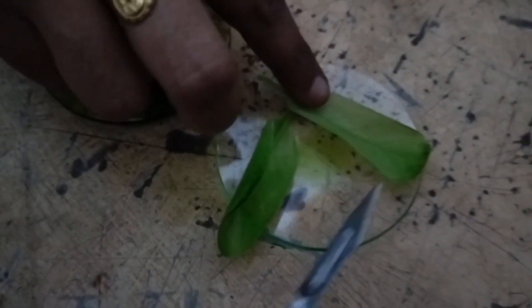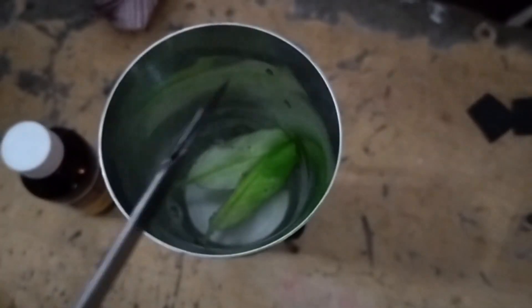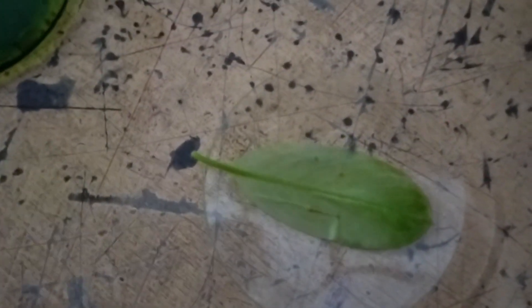See the leaves' colour. The first leaf's colour has turned to pale yellow. So we will take that leaf for the experiment. Now I am keeping those leaves in hot water, washing them, and now we are going to test the leaf with iodine.